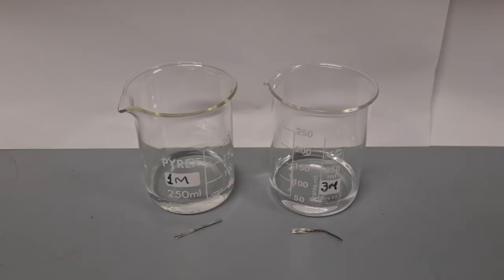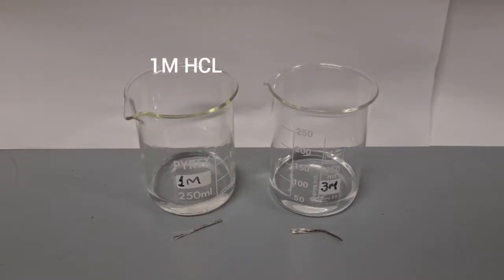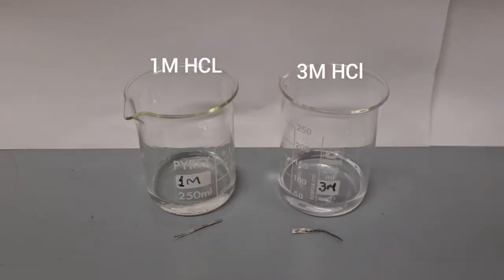I have two different concentrations of acid, this one molar concentration, and this is a stronger hydrochloric acid, three molar concentration.